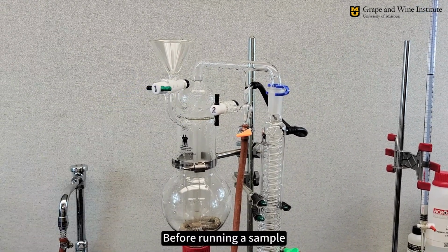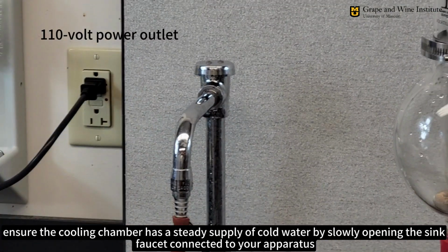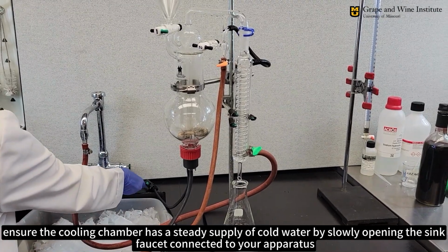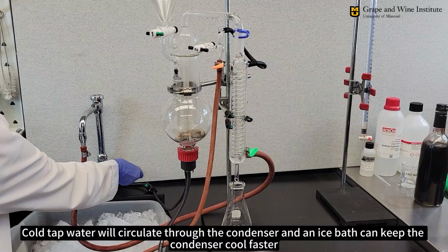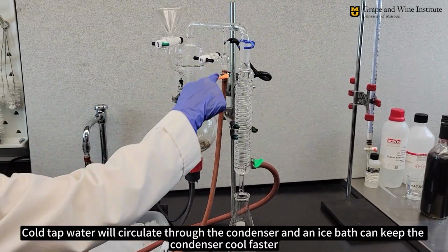Before running a sample, ensure the cooling chamber has a steady supply of cold water by slowly opening the sink faucet connected to your apparatus. Cold tap water will circulate through the condenser, and an ice bath can keep the condenser cool faster.